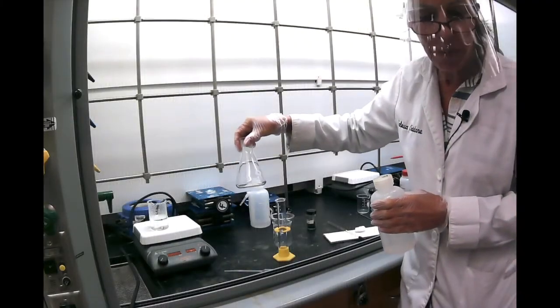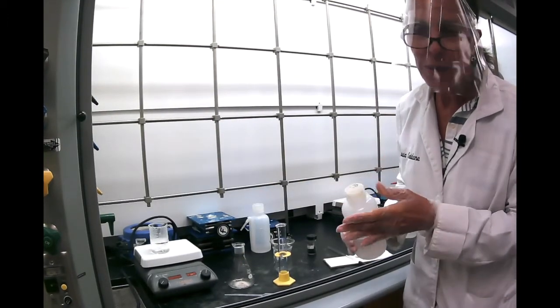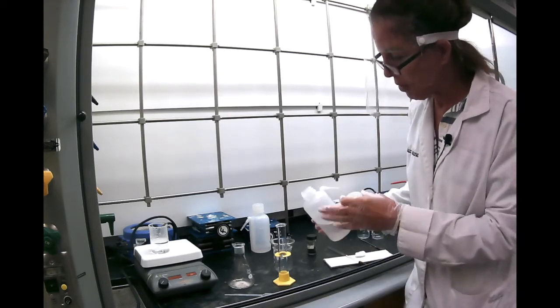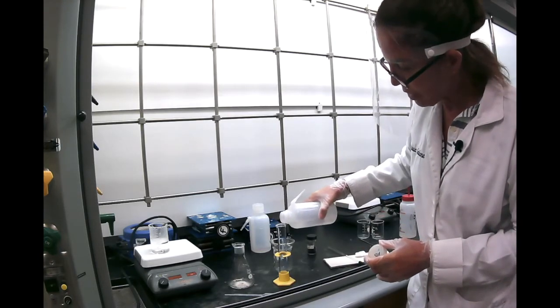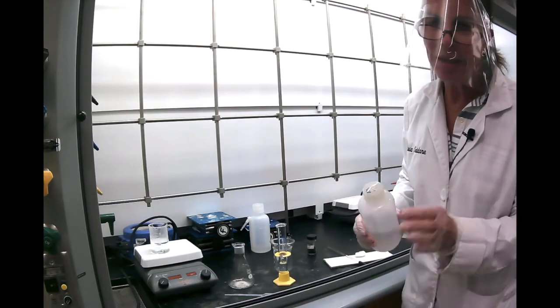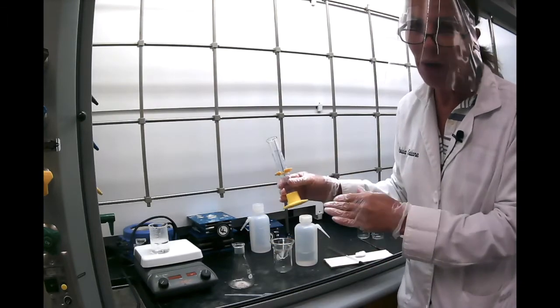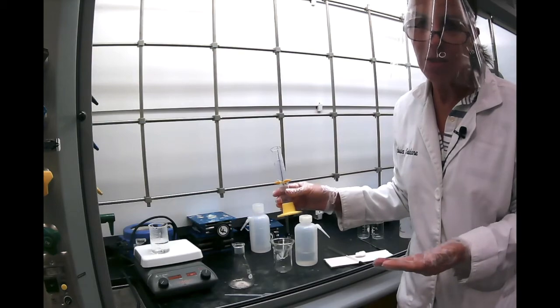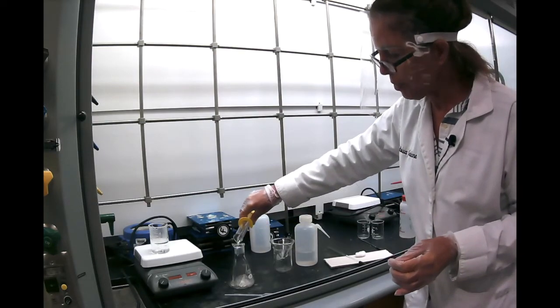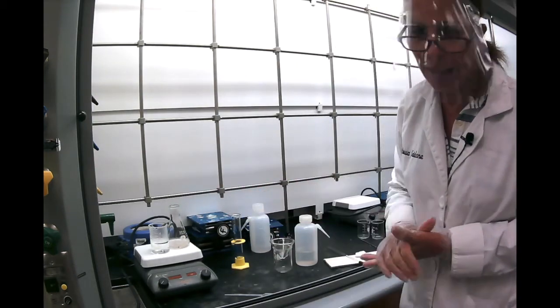So now that we have our crystals here, we're going to add water, and we established that water is the best recrystallization solvent for acetanilide. So the procedure says to add 20 milliliters of DI water, and again, this is not really exact because eventually it will evaporate, so the amount of water is not part of your calculation, so don't waste too much time measuring the exact amount, okay? I'm going to put some DI water there, and then you let it heat on the hot plate.